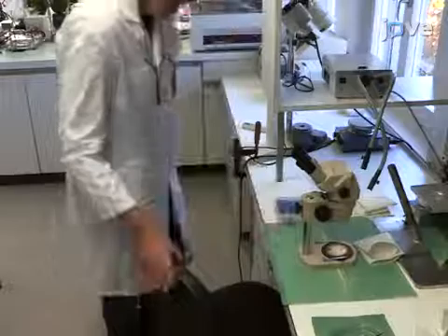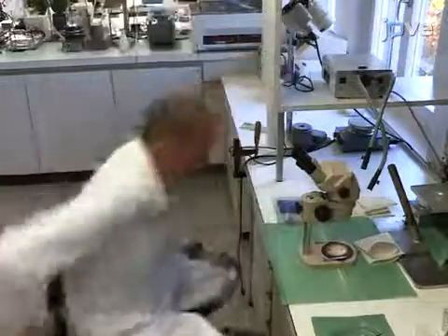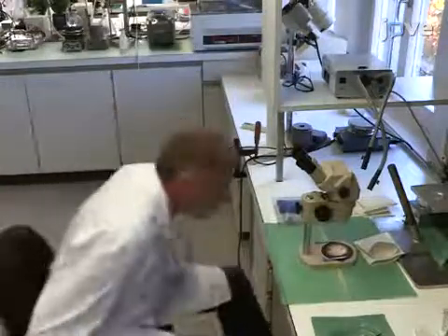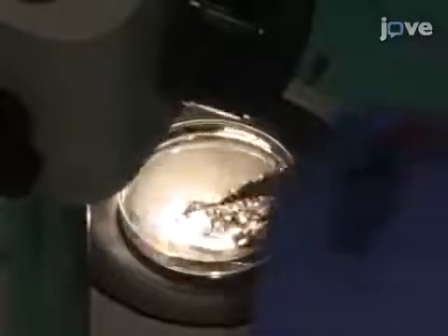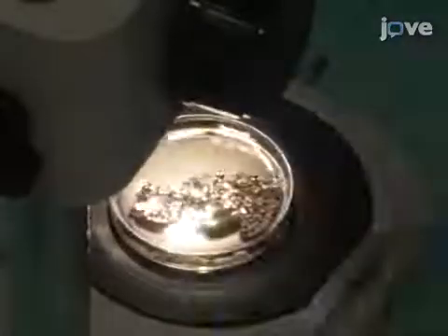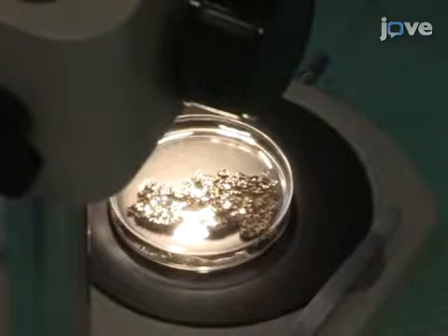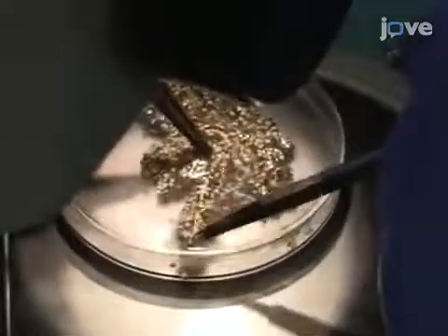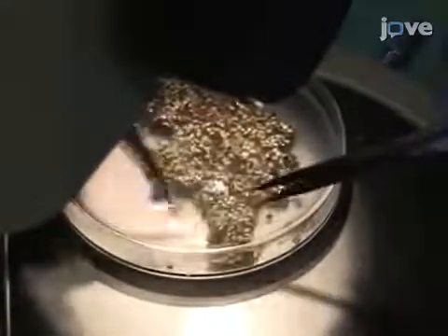After removing the lobes of the ovaries from female frogs, according to the text protocol, place the lobes in sterile modified Barth solution supplemented with penicillin and streptomycin. Cut open the lobes to allow access of the tissue to oxygen.